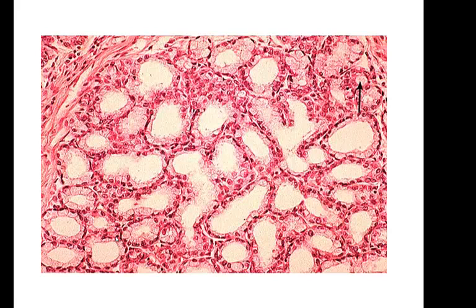Now you might be asking yourself, why isn't this stratified? Why isn't this considered many, many layers? And it's because we have an open lumen here, and this is just a single layer. Every single cell is touching a basement membrane here, and then it's open to a lumen. So this group of cells opens to a lumen and rests on a basement membrane. This group of cells opens to a lumen and rests on a basement membrane.